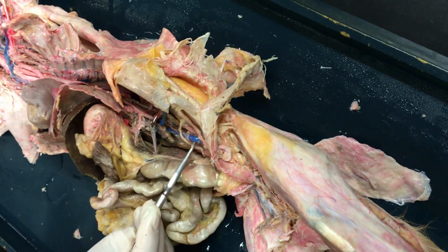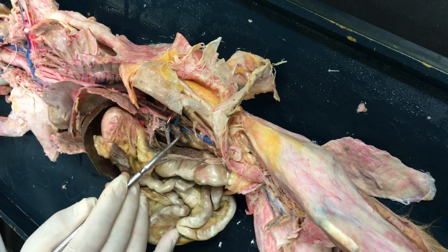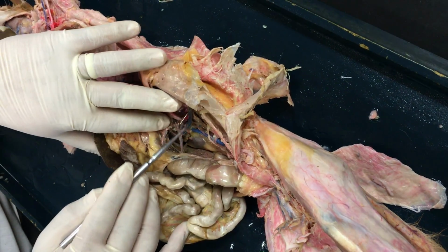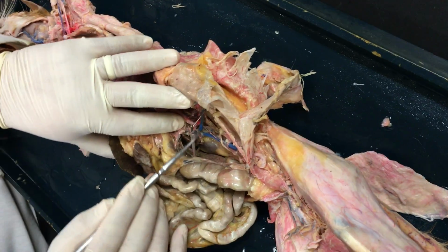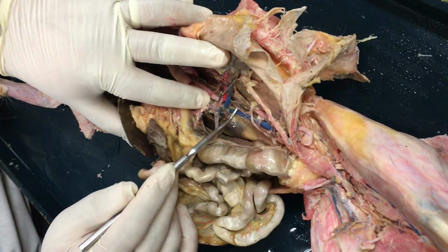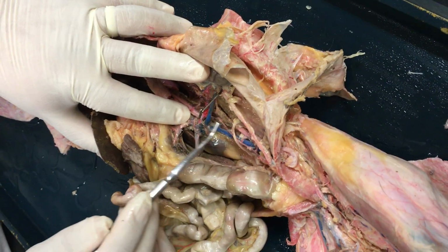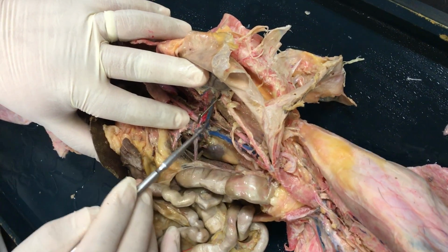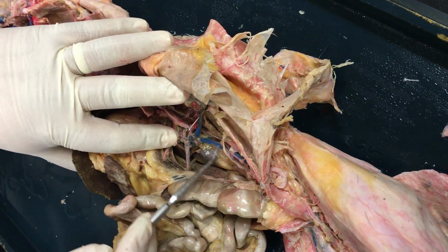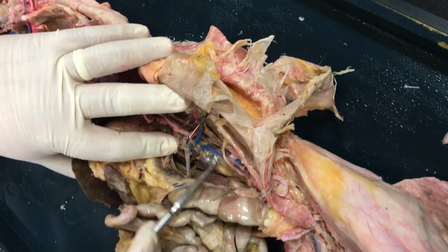As we make our way up the inferior vena cava, on the left side, we only have one main branch here, and that's going to be the renal vein draining back into the inferior vena cava. Keep in mind that on the left side, the gonadal vein would drain right into that left renal, whereas on the right, you would have a gonadal vein draining into the inferior vena cava.